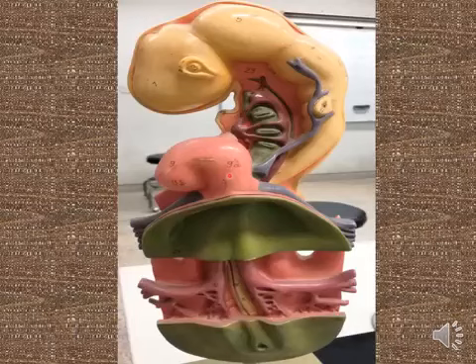The bulbus cordis is not found in these sections. Okay, atrium, ventricle, and the sinus venosus. The sinus venosus consists of the transverse part and the left and right sinus horns. Each horn has three tributaries.